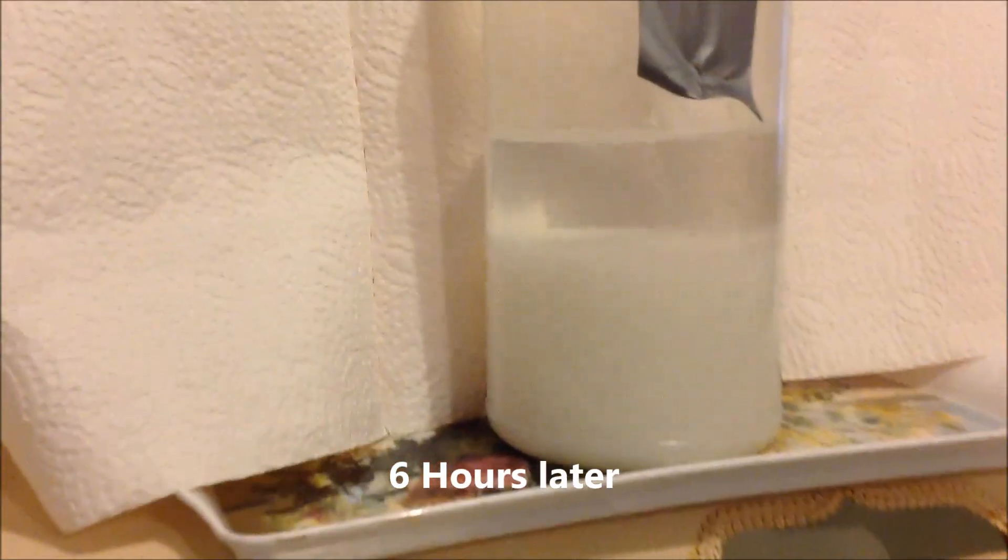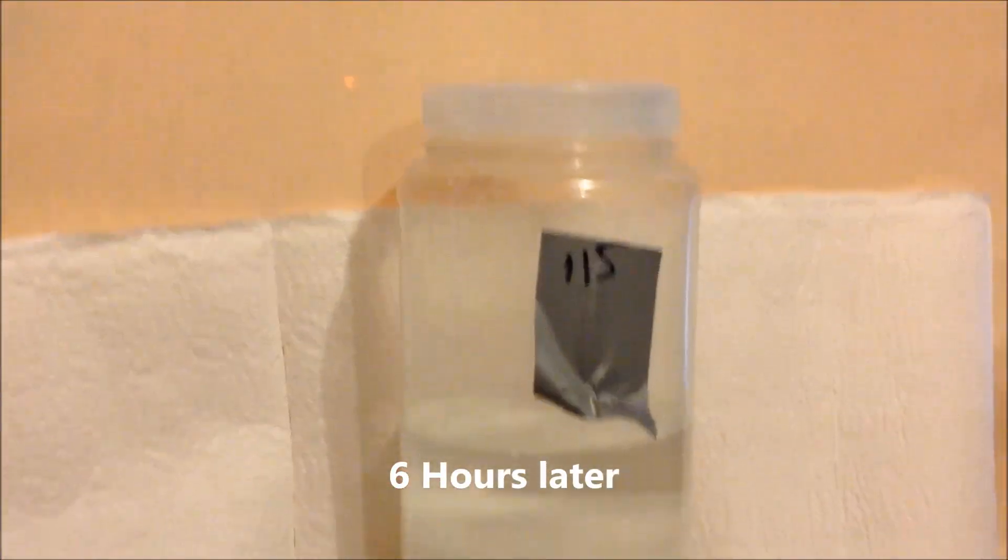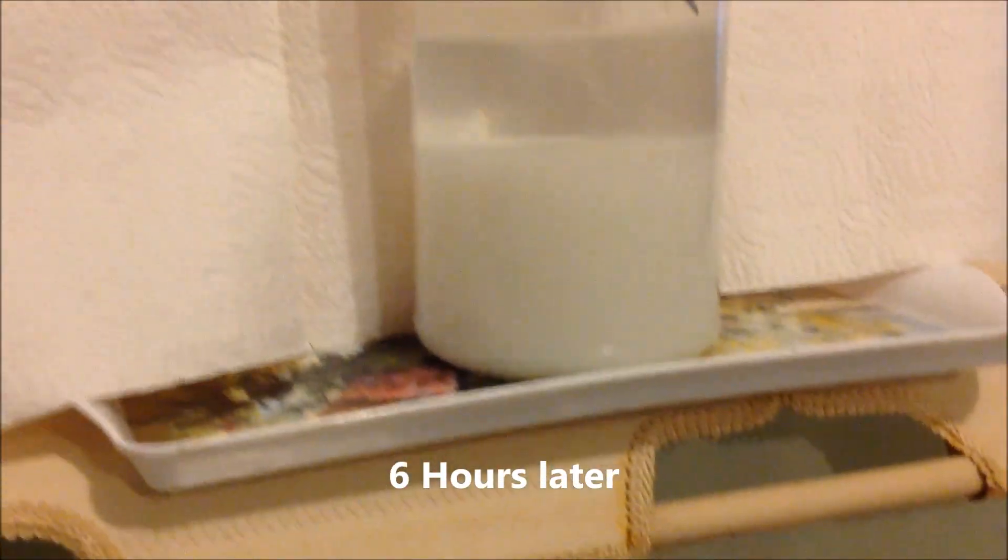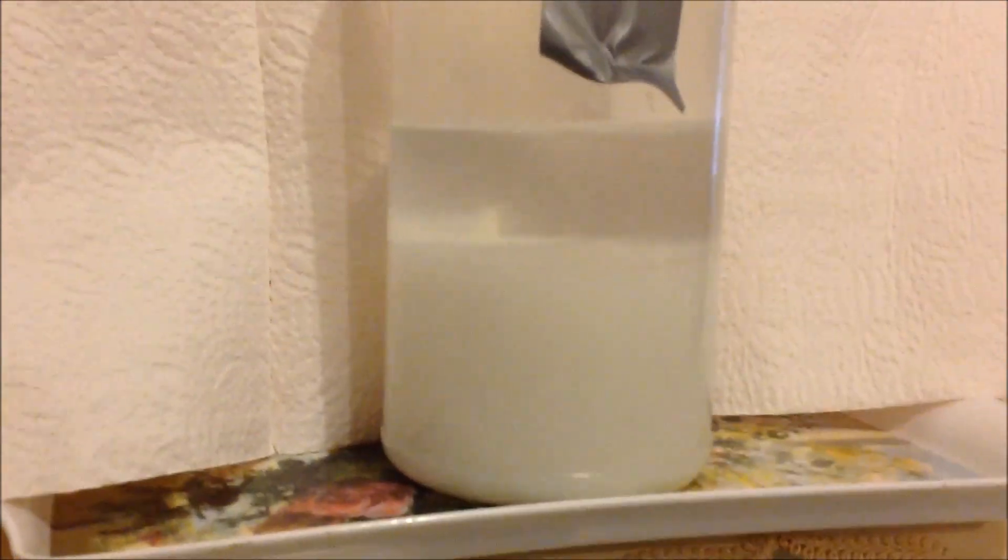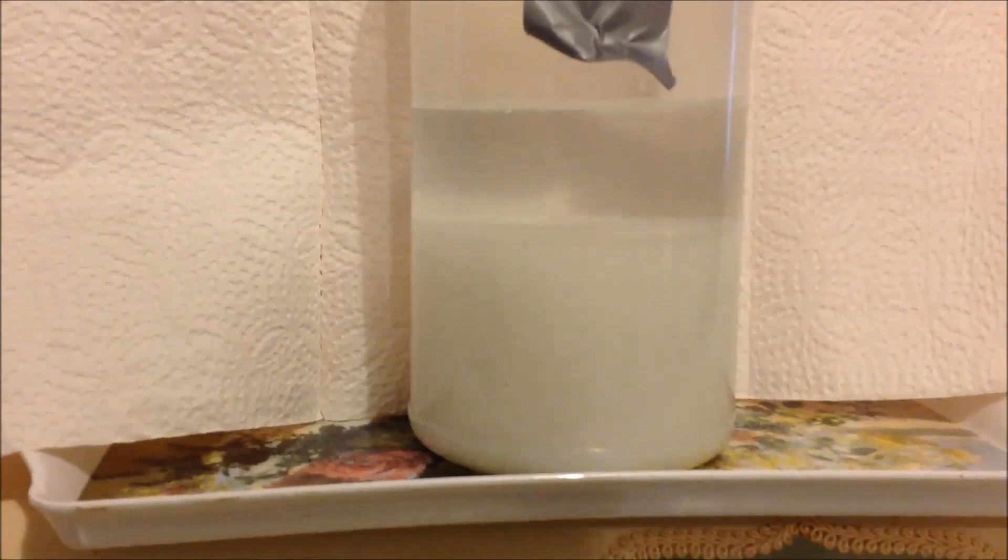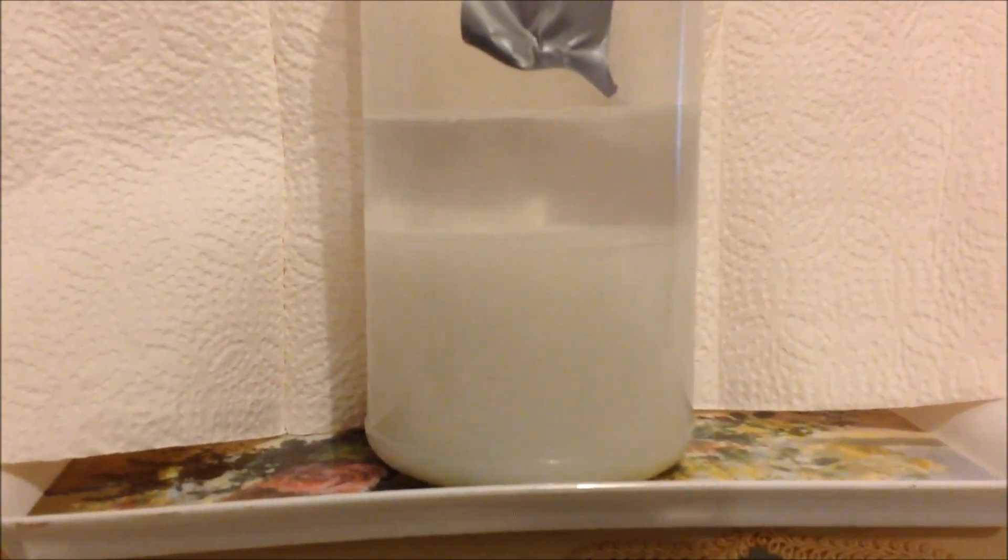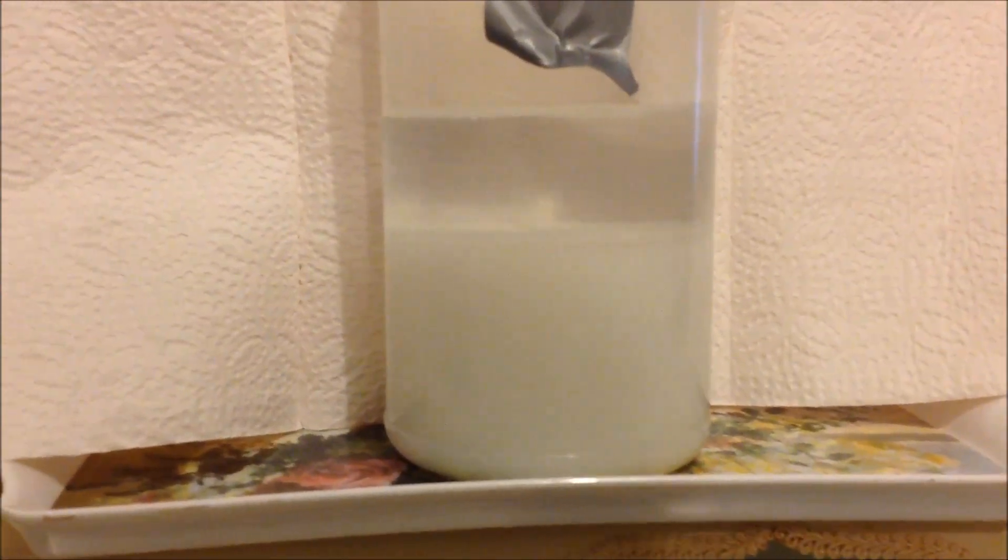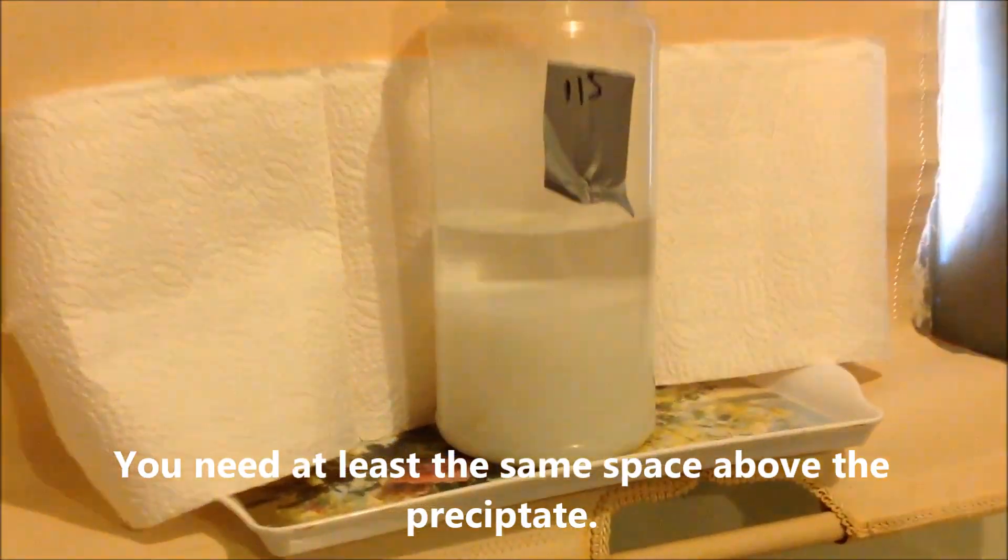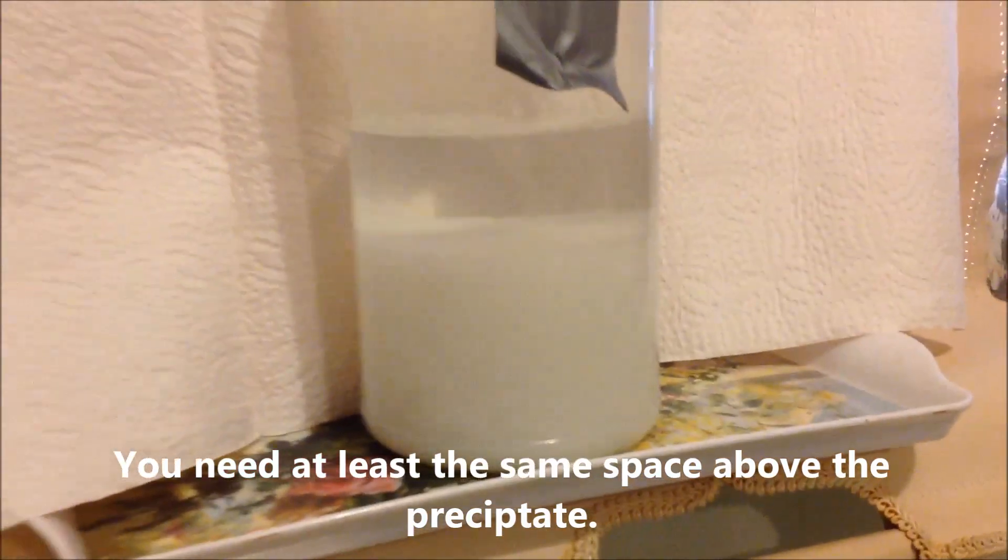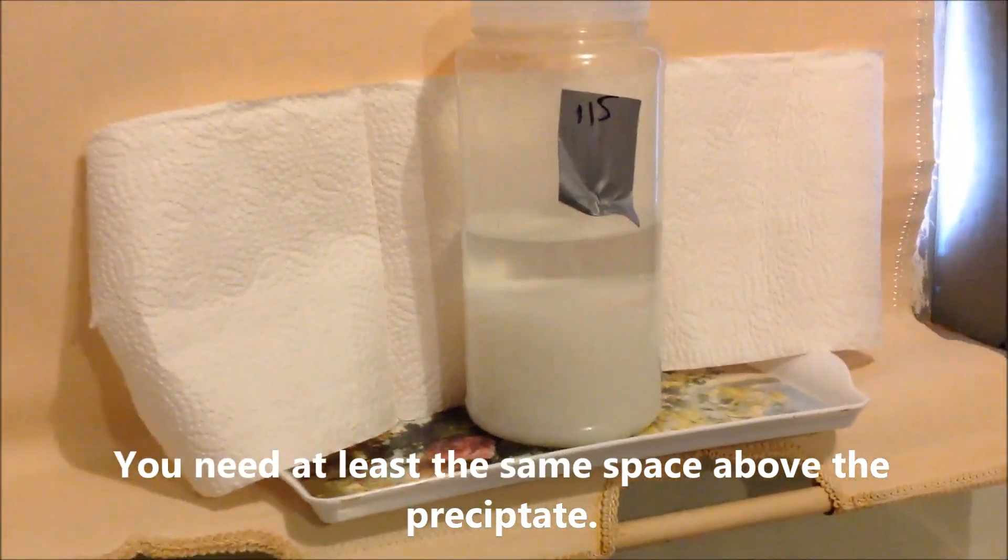Well it was during my lunch hour that I set it up. Oh by the way that number there, I'll just give every test a number and keep track of it in my logbook that way, don't get things mixed up. So we're about 6 hours settling. I'd normally leave it overnight, but now you can see why you need such a large container, because it does produce a large amount of precipitate and we do need to wash that.